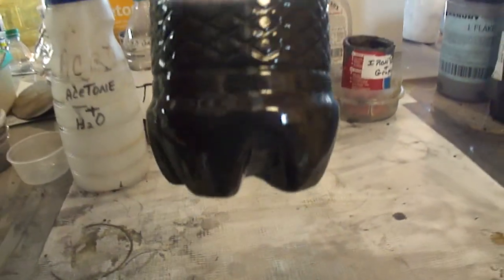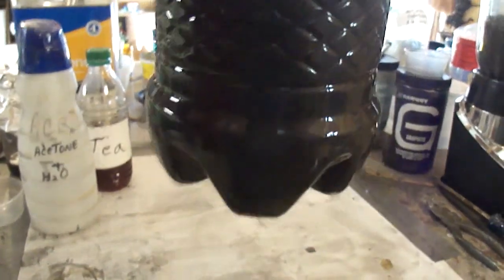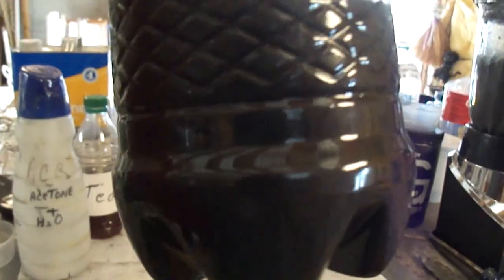This is the graphene in the tea suspension. As you can see, it stays suspended. This is over a week old.